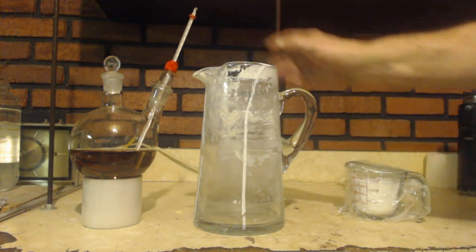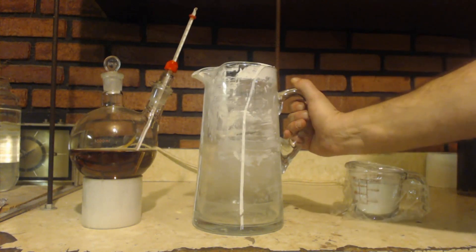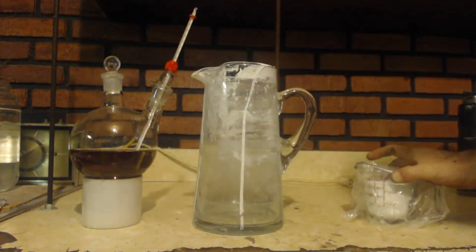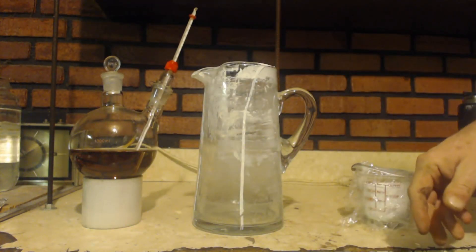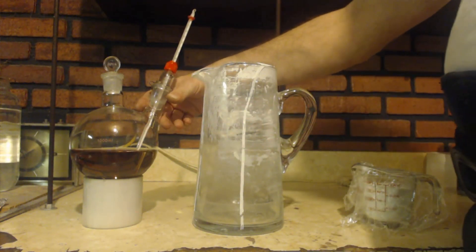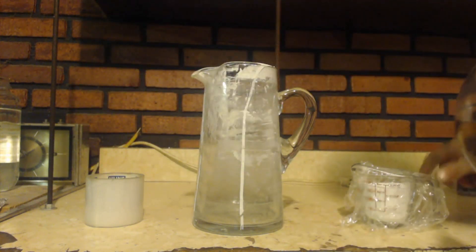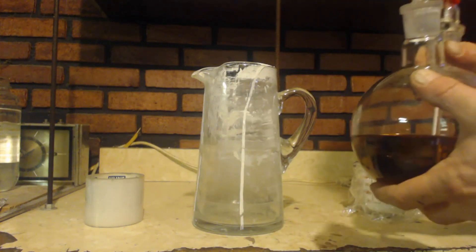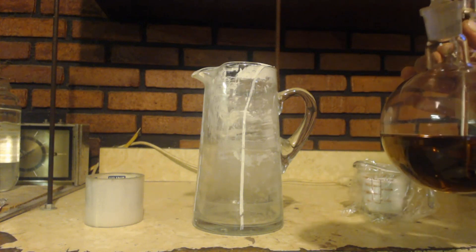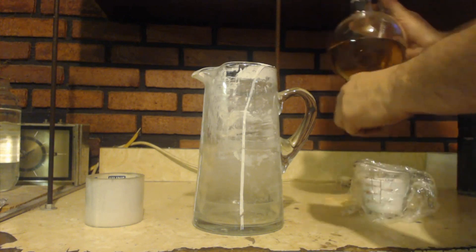You might ask if it was dirty while I was making some calcium hydroxide in this — it's just the same stuff, so I left it in there without cleaning it. I'm going to dump this in and keep adding it until the pH is seven, checking it every once in a while. After I get about half of it in, I'll probably check if it's neutralized. Now, if you have carbonate, it's going to produce CO2, so you've got to do it little by little — you can't just add it all in at once.